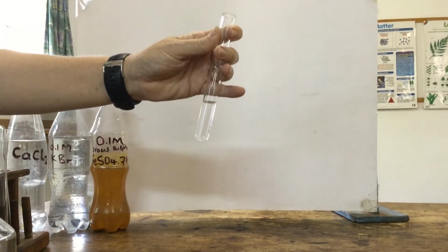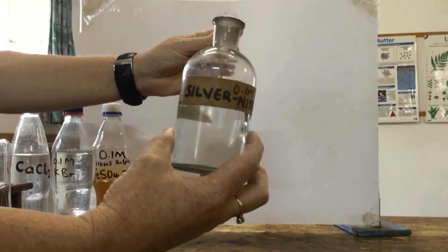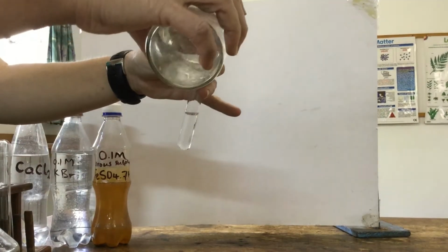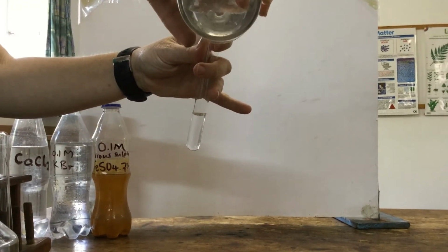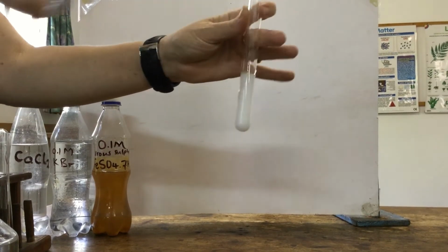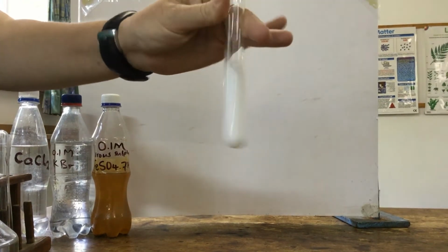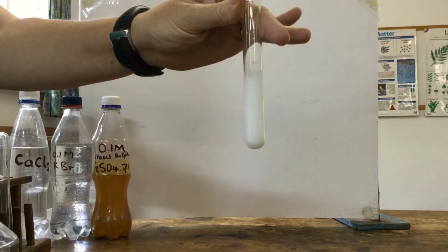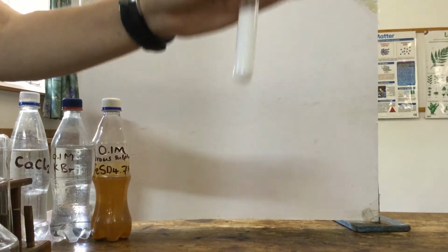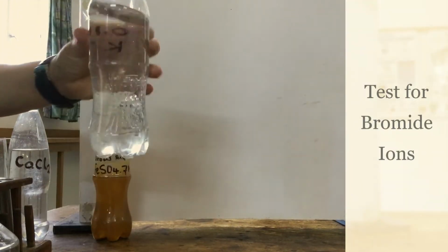Here's our silver nitrate. The silver in the silver nitrate will form a white precipitate with the chloride ions. So we're watching for the white precipitate. There you can see a white precipitate that is formed with the silver ions. That is a positive test for chloride ions. We use silver nitrate.